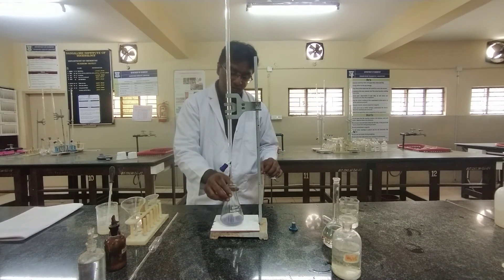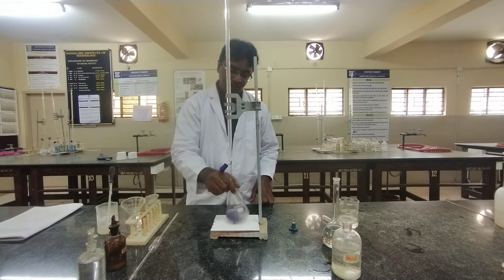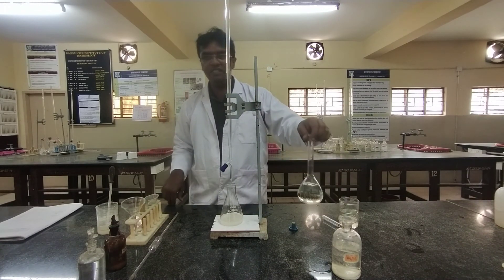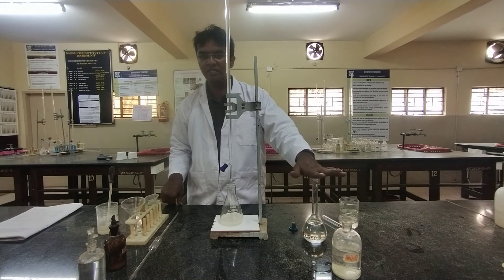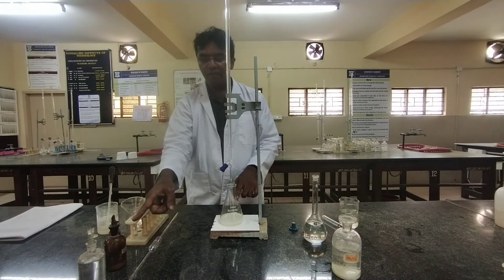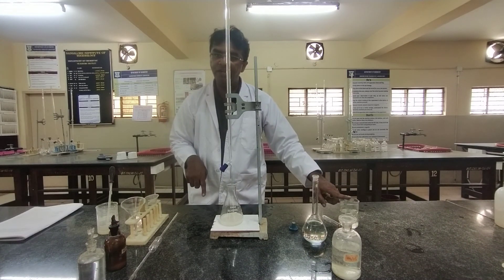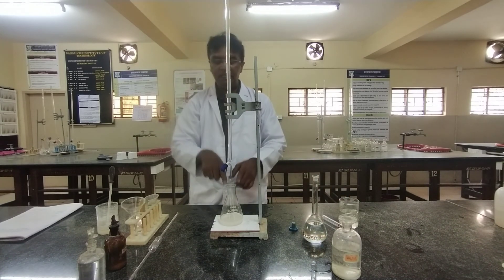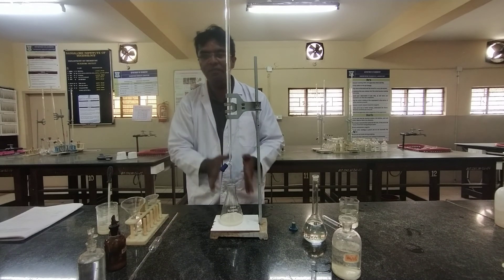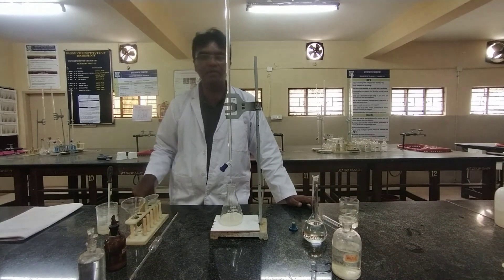If the blue color reappears, that is because enough acetic acid was not added; in that case add a few more drops of sodium thiosulphate until the blue color disappears. To summarize: part one — take fixed amount of brass solution, add water to the mark, close lid, shake for uniform concentration, and fill the burette with sodium thiosulphate. Part two — pipette 25 ml brass solution into a conical flask, add ammonia drop by drop till blue color appears, add excess acetic acid to maintain acidic condition, add one test tube of KI (yellow color appears), titrate against sodium thiosulphate till pale yellow, add 8–10 drops starch, continue till blue disappears. Once you get the titration value, you can easily calculate the percentage of copper in the given brass sample.